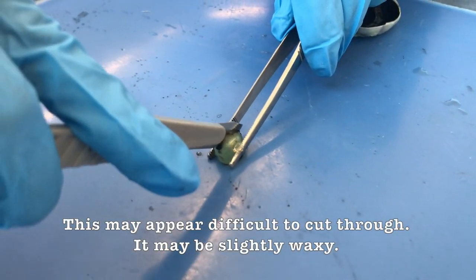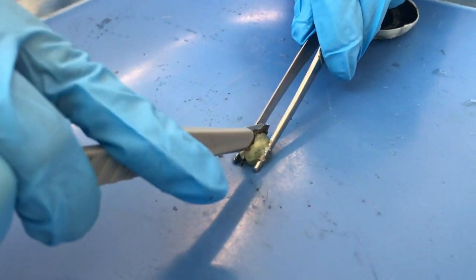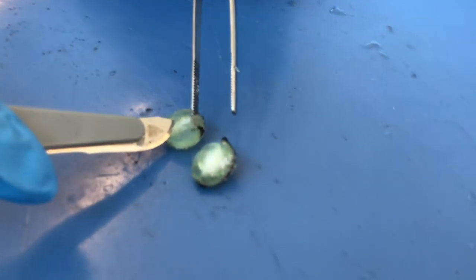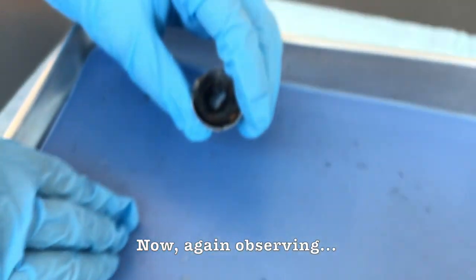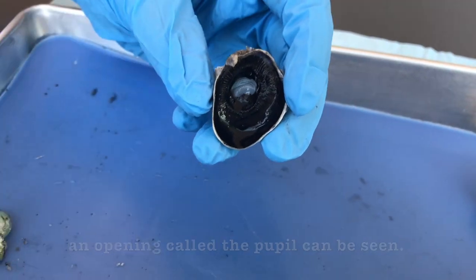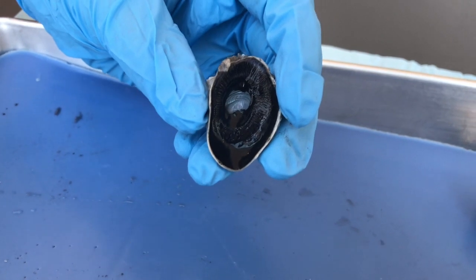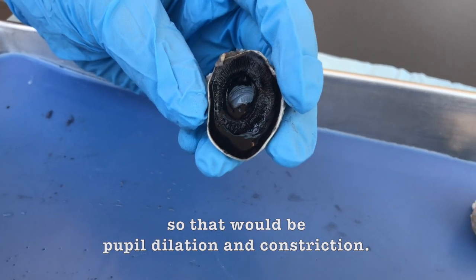This may appear difficult to cut through, it may be slightly waxy. So here we have our two halves of our lens. Now again observing the anterior portion of the eye. So now that the lens is removed, an opening called the pupil can be seen. The pupil allows light to enter the eye, and it's located at the center of the iris. Two muscle layers of the iris control the size of the pupil, so that would be pupil dilation and constriction.